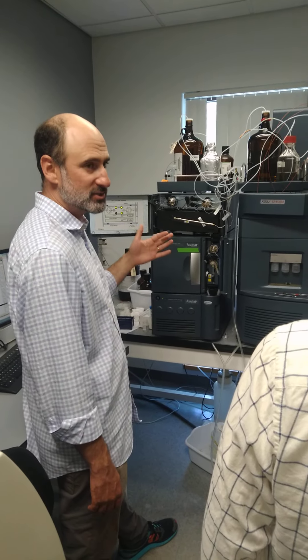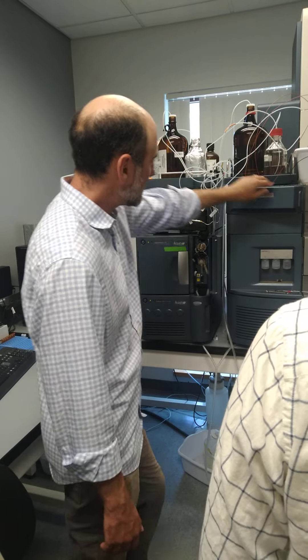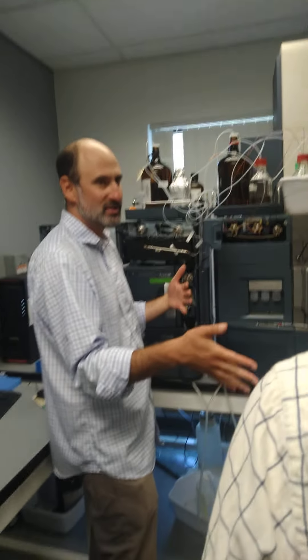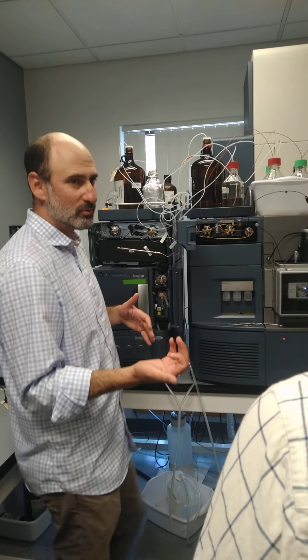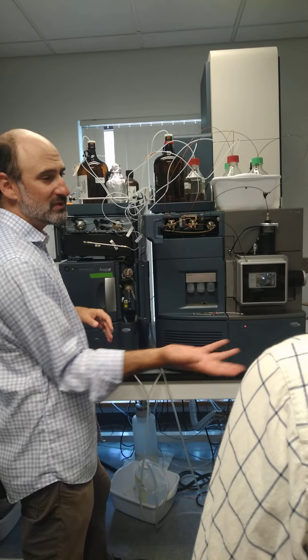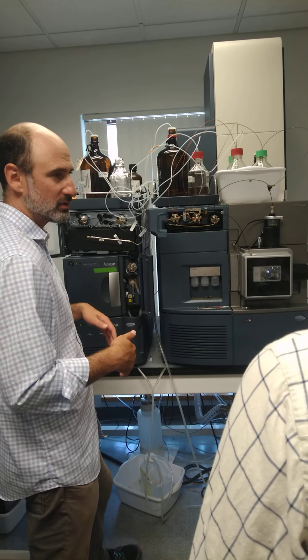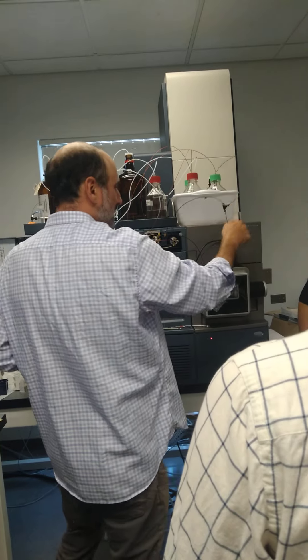Always blank the column before you use it — run a blank on every column type before you use it. Once it comes off the column, it goes through this true divert valve right here on the instrument. For the protein method, it diverts the first two minutes of the five-minute analysis to waste. That allows you to put on eight-molar urea or conjugation chemistry salts. You don't have to worry about salt on this instrument — you can bring a protein right out of imidazole, dilute it, and run it right off your desalting column. This also works for metabolites with lots of salts — do it all online and not worry about losing things on a desalting filter. Then, further down, it's splitting the flow to a waste bottle so only a portion goes into the mass spec to help keep things cleaner. And that's kind of how the system works — I'll go through the software now.